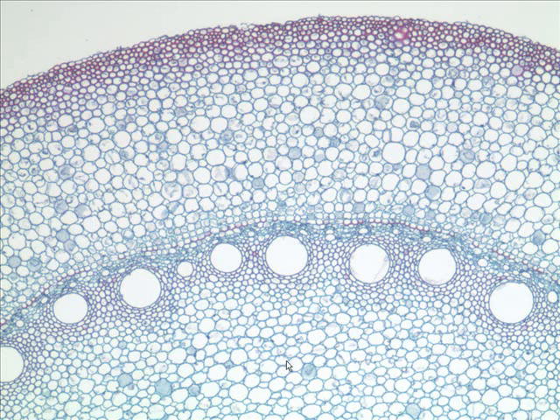Now, how do we distinguish this parenchyma out here from this parenchyma in here, more toward the center? There's a couple terms. One is for the outer parenchyma and the other for the inner. What's the term for this parenchyma out here? In terms of where it is, the cortex. And this is what location down here? The pith. Yes, the cortex and the pith. Outer parenchyma, inner parenchyma, cortex, and pith.